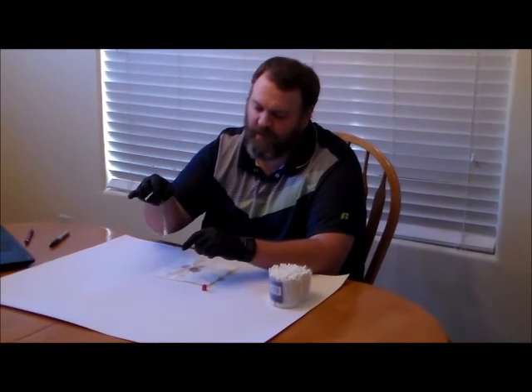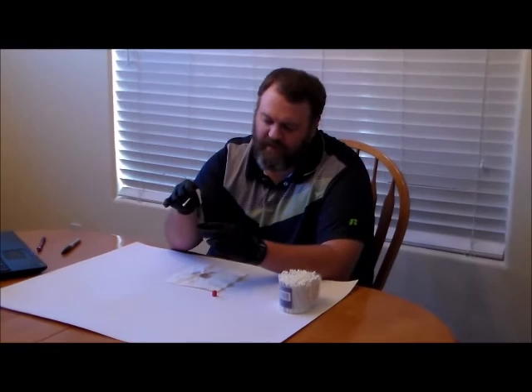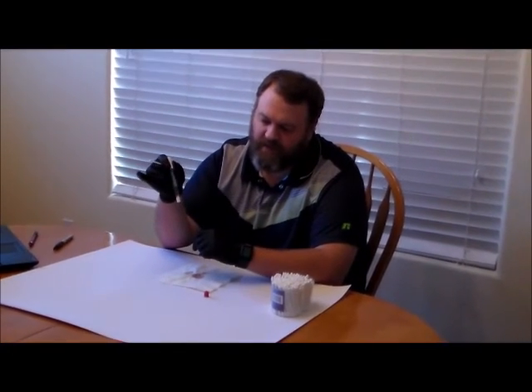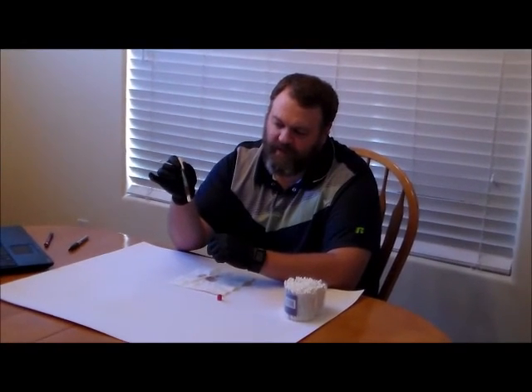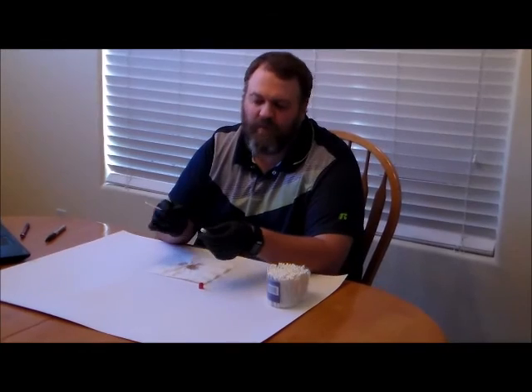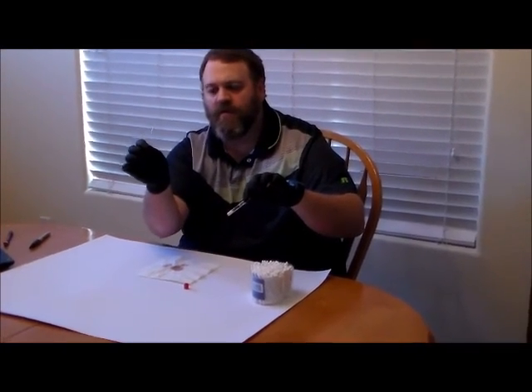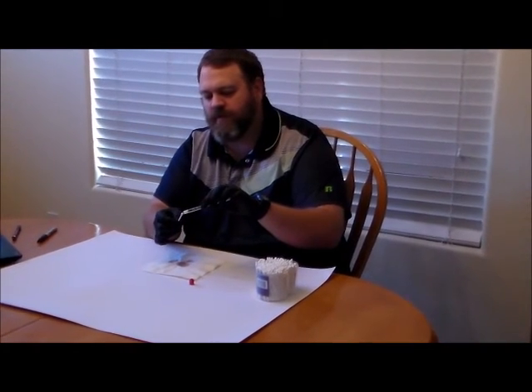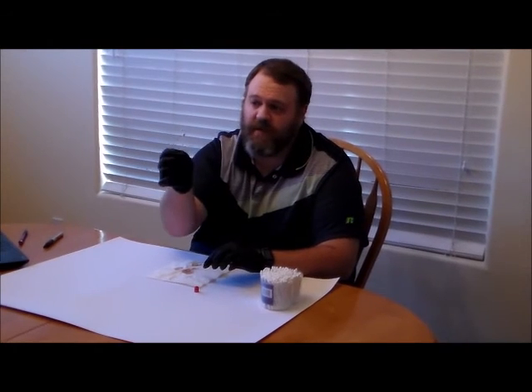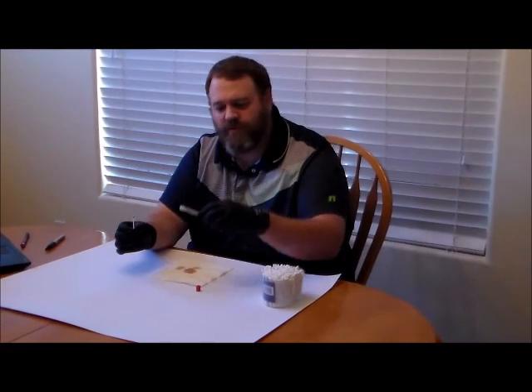We're going to leave the little cotton swab stopper on the end and let the chemicals soak into it, saturating the swab. Then all we do to use this in the field is simply touch the end of our swab to our chemicals here, and then look for a positive change. You can see that we're getting a positive reaction — that bluish-green color.